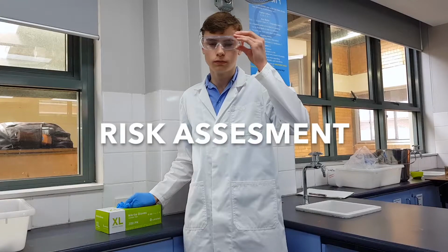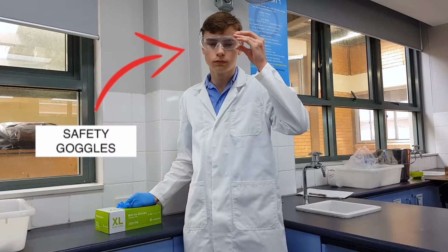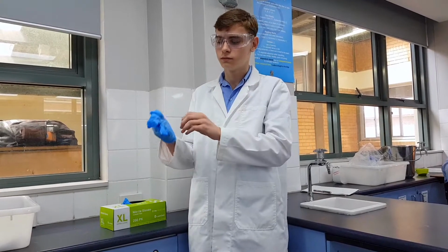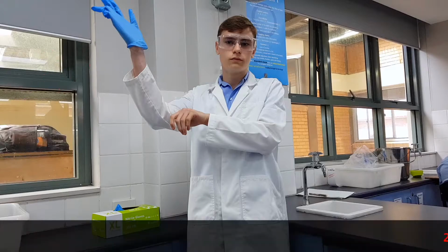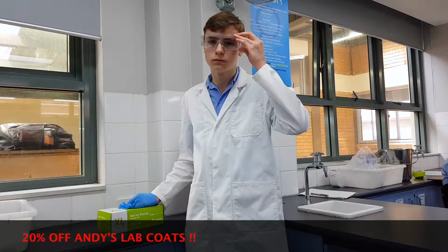Firstly, it is important to discuss the risk assessments to this experiment. As always, safety glasses are worn to protect the eyes from any substances should they in the slightest of situations end up near the face. Slap on a pair of gloves when dealing with liquids to protect against irritation towards the skin. For this experiment, a lab coat is also worn to protect the delicate Waverley coloured uniform.